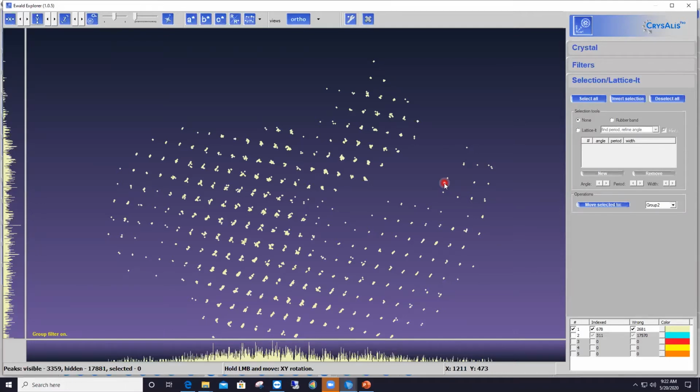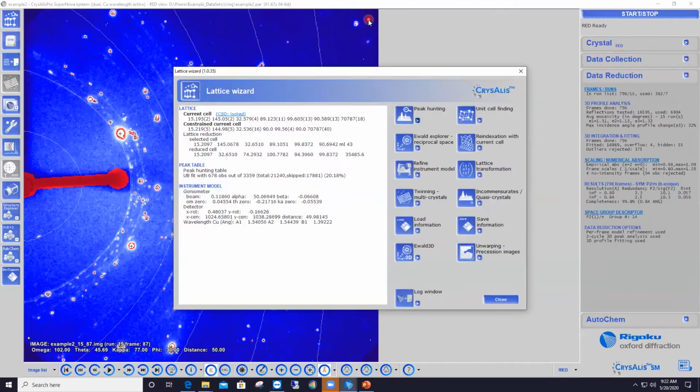Okay. So now I need to try and index the reflections that remain and see if I can get a better indexing. So typically I would get out of the reciprocal space viewer now and clean up the reflection file. The thing is that so far I've cleaned up the display, but those green reflections are still in the reflection file. The thing is though that once I've put them in a different group, they have now attached to them a flag, okay? And I will use this flag to delete all those flagged reflections basically.